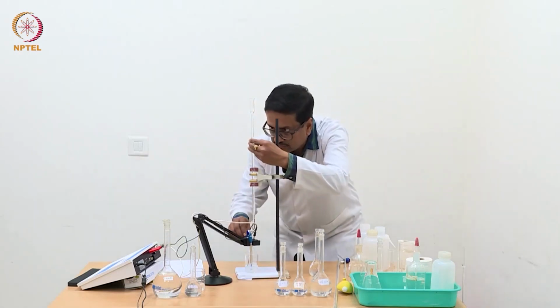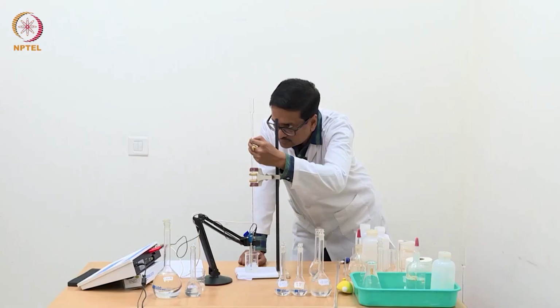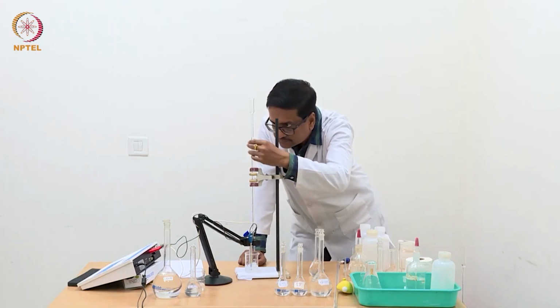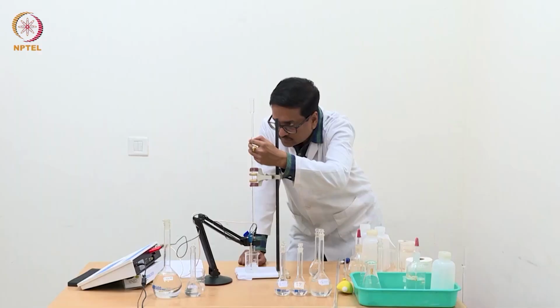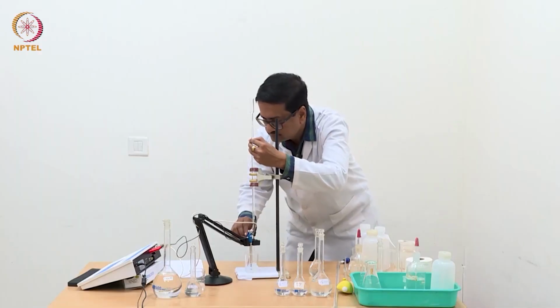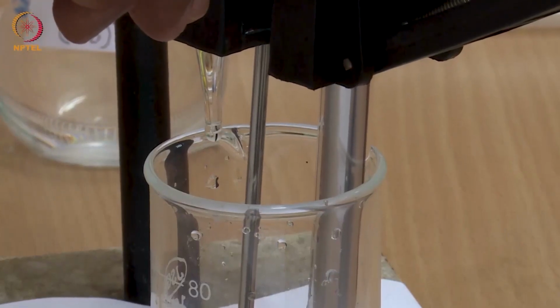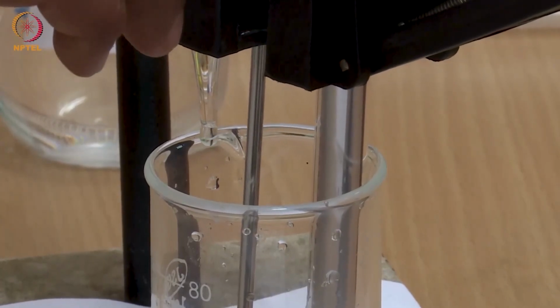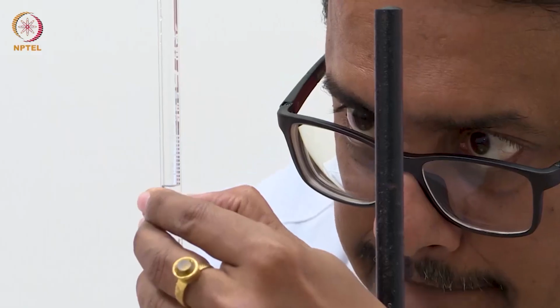We will add another portion. So, I will add 0.25 ml again.